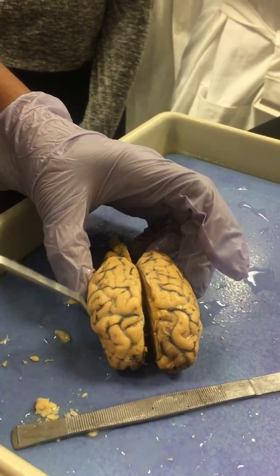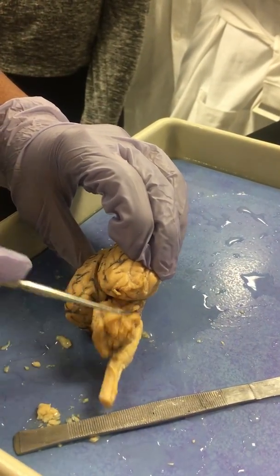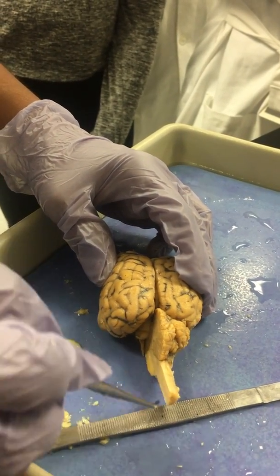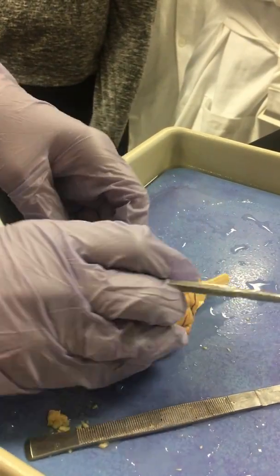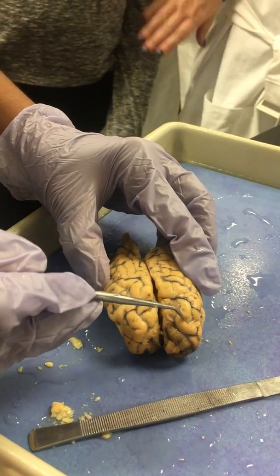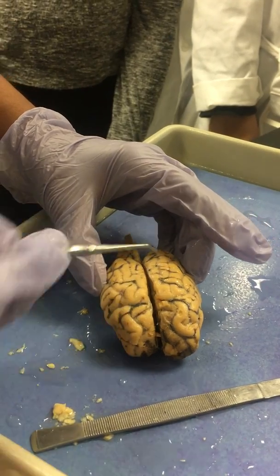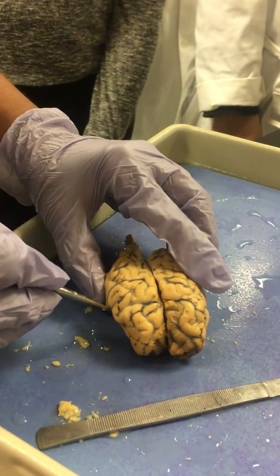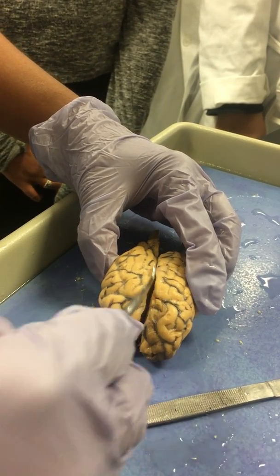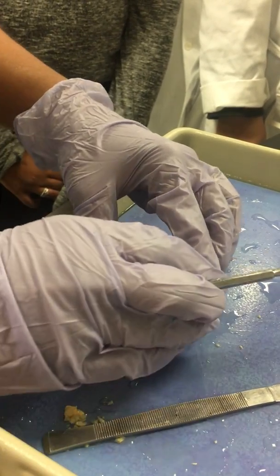So you'll see the cerebrum, both the cerebral hemispheres, versus the cerebellum. Of course, I did a sagittal cut right here so you can only see one side of this. And let's talk about the major structures first. This is the gyri, and these are the sulci, which are the valleys or deeper lines. And even deeper, we have a fissure. So this one here that connects both the cerebral hemispheres together is the longitudinal fissure.